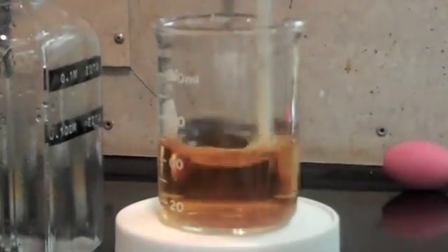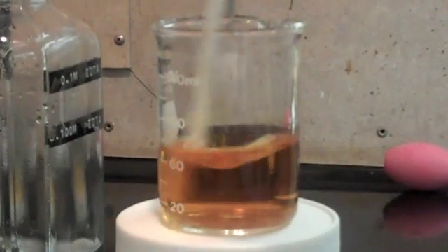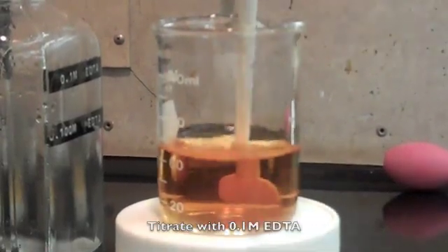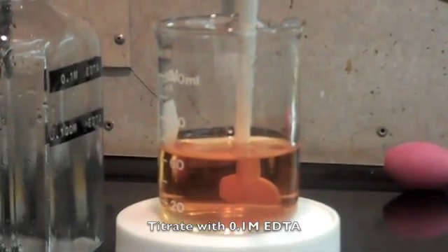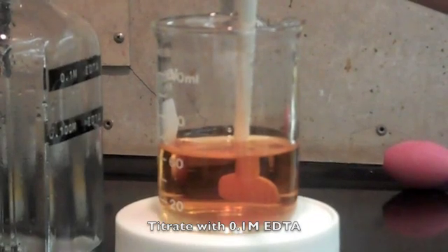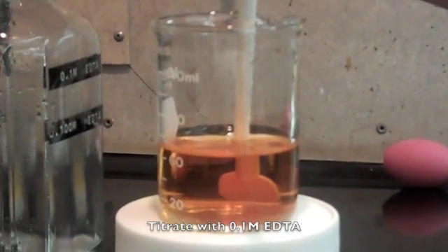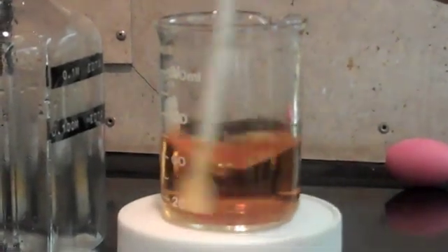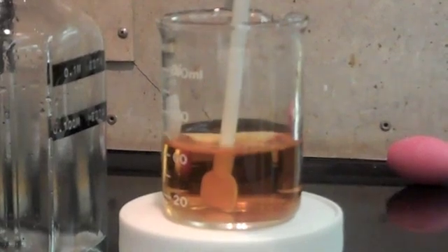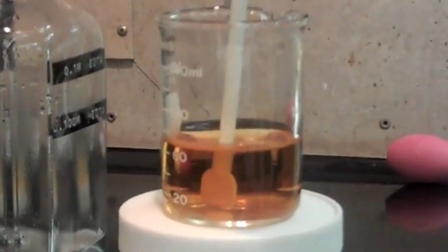We're going to titrate with 0.1 molar EDTA today. Some people will use 0.0575 molar, just make sure the strength that you're using is the strength that is recommended in the procedure because that strength will be taken into account in the calculation.